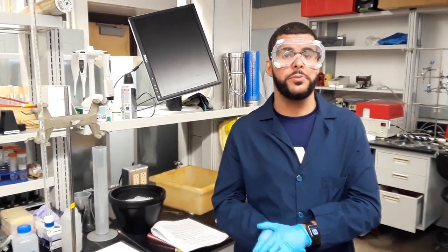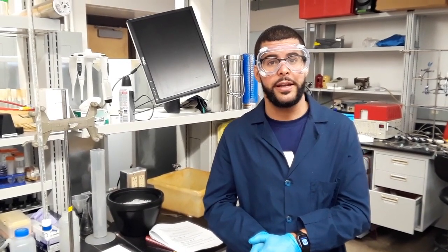I hope that this video helped you in learning how to use lab glassware and how to teach it to your students.